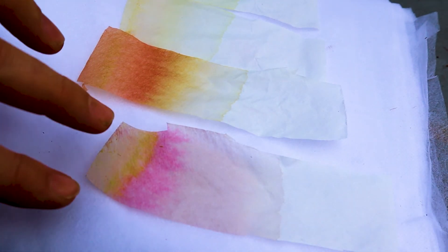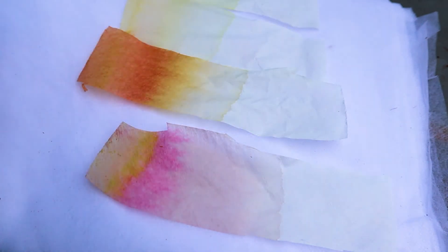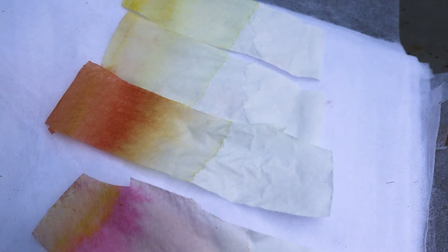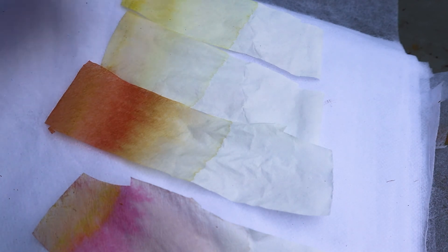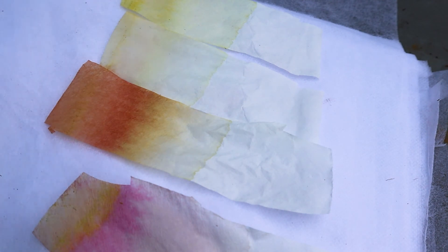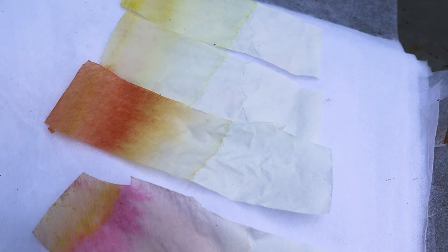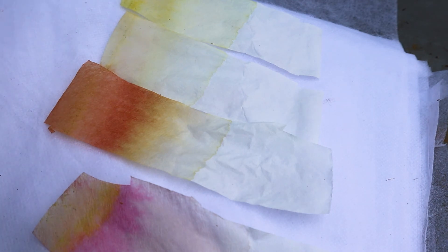Next we've got the one from the coleus leaves, which we did as the extra, and this one's turned out really well too. You can see it's picked up all of that yellow and green up at this end, and then all the pink and purple has spread and carried on travelling up through the paper. If your result turns out a bit pale, just put more leaves in it, and try to crush them up more — maybe with a pestle and mortar, which would do a really good job.